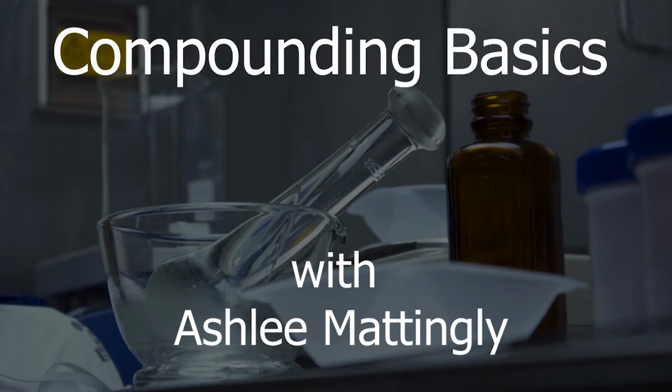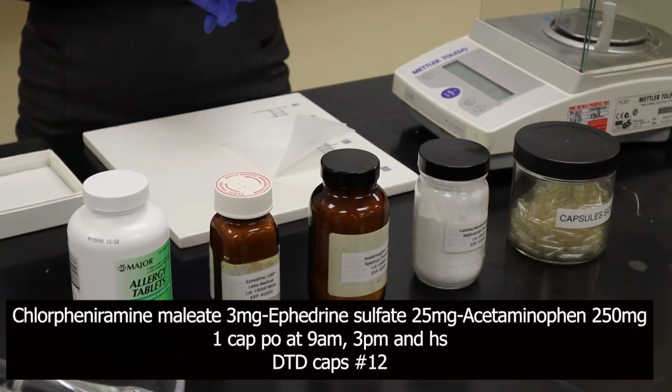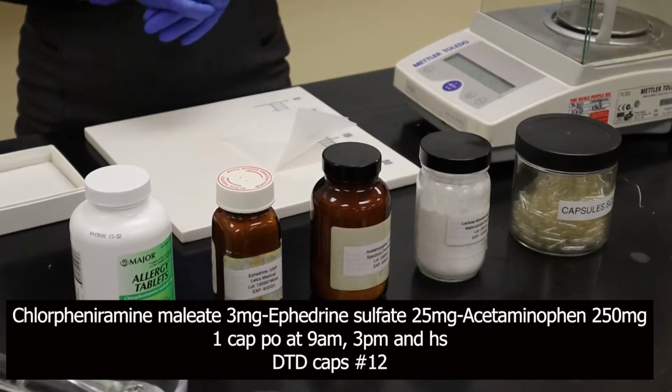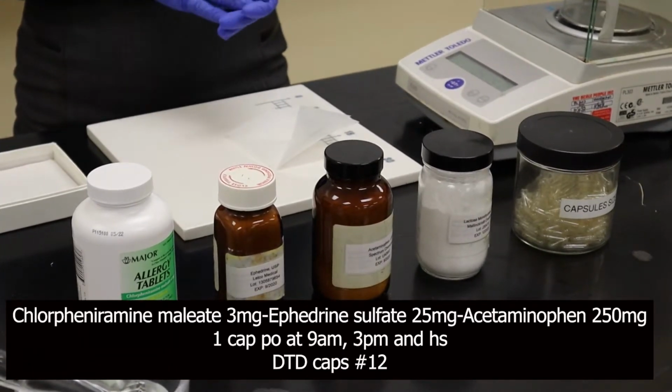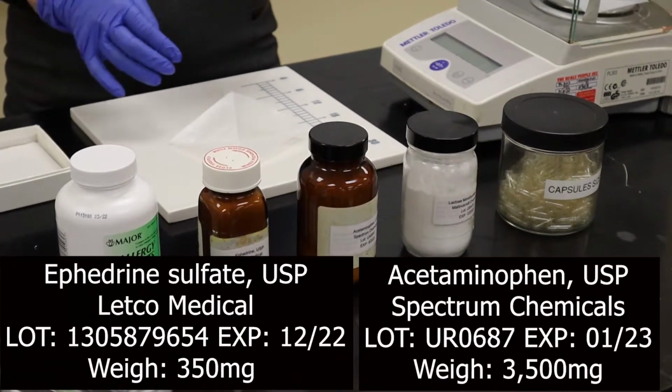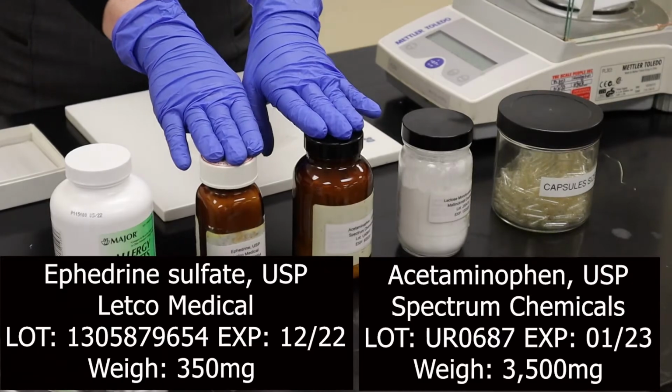We review basic compounding technique. In this video, we're going to be preparing a combination capsule that contains chlorpheniramine, ephedrine, acetaminophen, and lactose in a size 0 capsule. First, I'm going to weigh out 350 milligrams of ephedrine and 3,500 milligrams of acetaminophen.